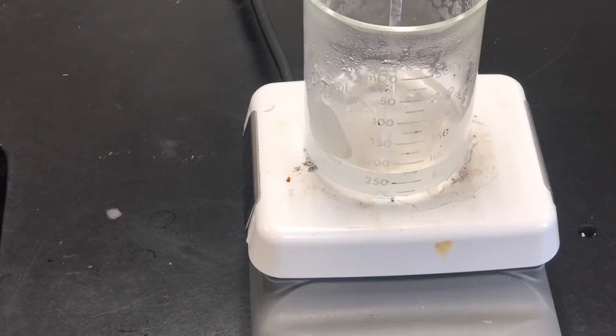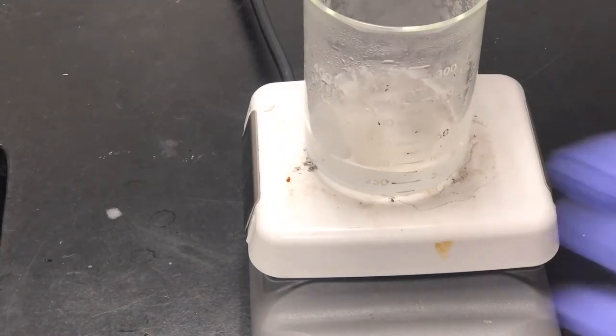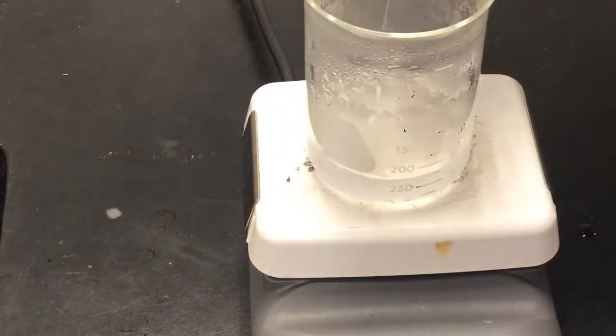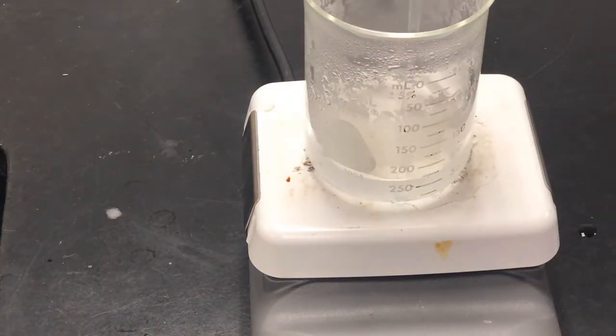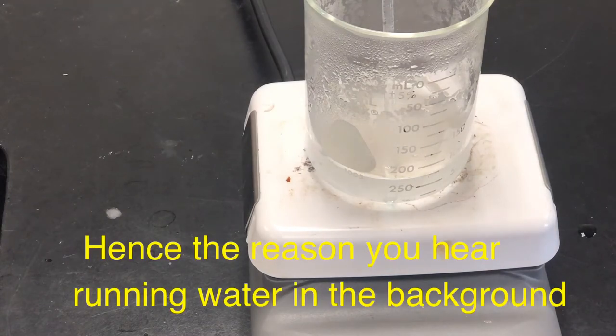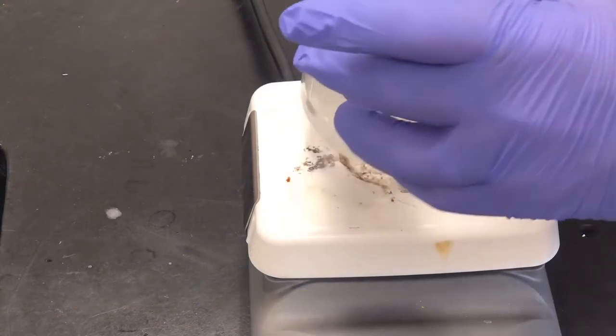One of the lessons in this lab is working with your lab partner. While one person is constantly stirring and watching this, seeing if we can get the crystals to dissolve, which we just did, someone else needs to be cleaning up the graduated cylinders, getting those put back, getting the filter funnel apparatus set up, getting the filter paper ready.